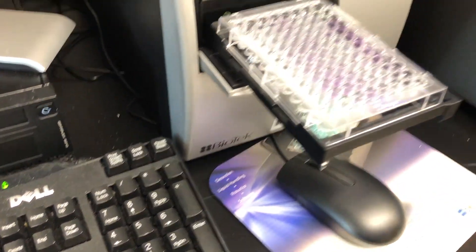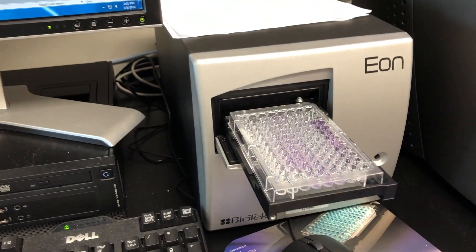Then I put the plate into a plate reader, which will tell me exactly how much purple is in each well.